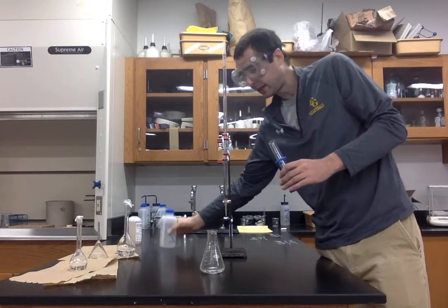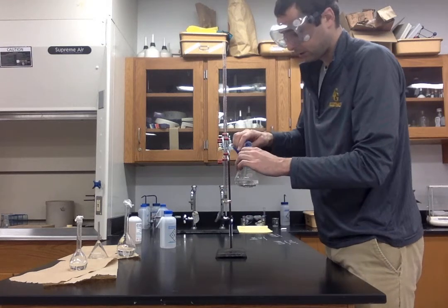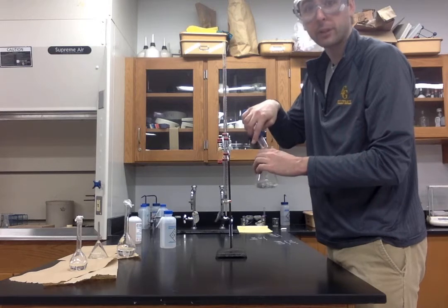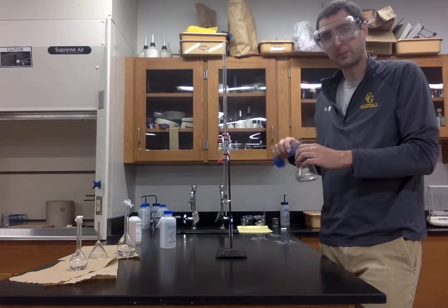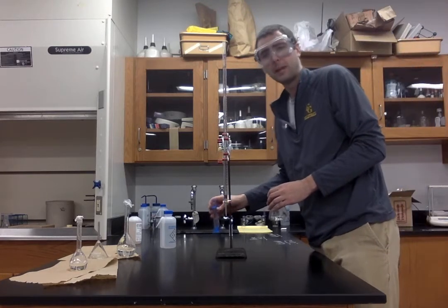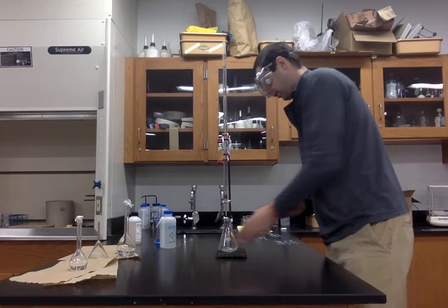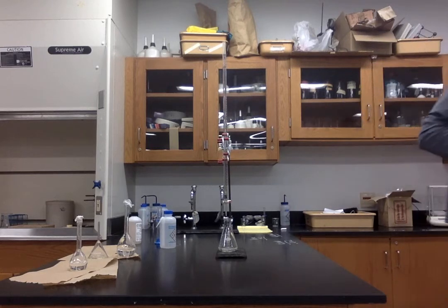Now you may be thinking, isn't that going to impact the concentration, Mr. Rice? It's a good question. We'll talk about that in the error analysis portion of the lab, when we actually finish collecting all of our data. Just keep that in the back of your mind. Okay, so I have my setup almost ready to go here. Let me get a plastic pipette.